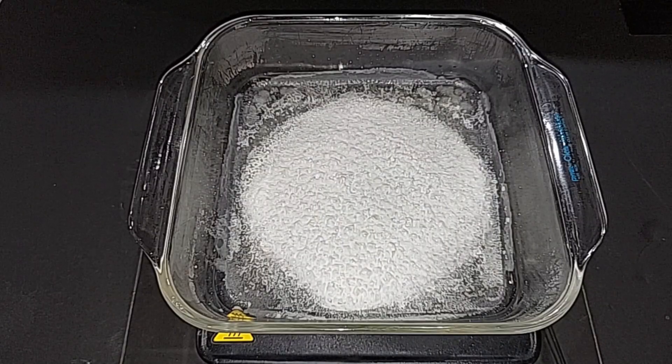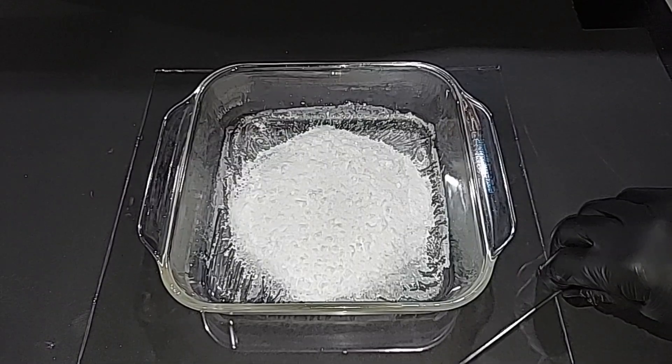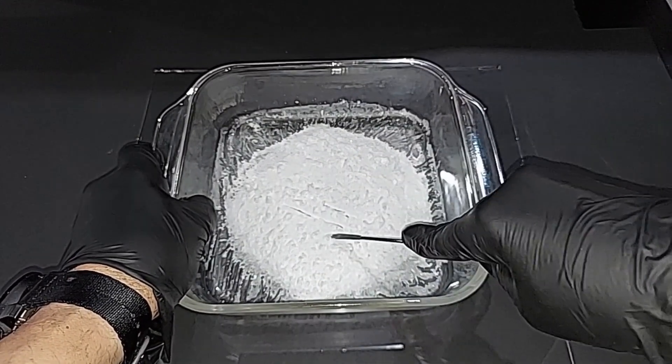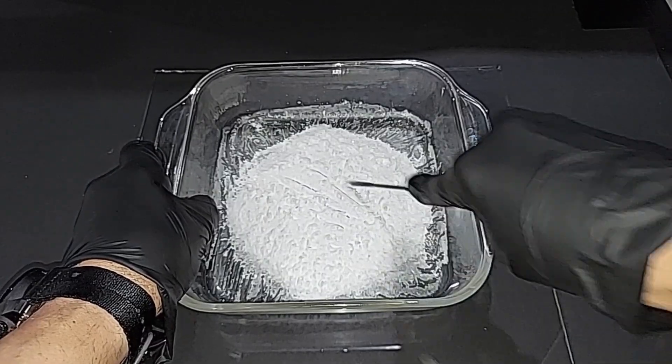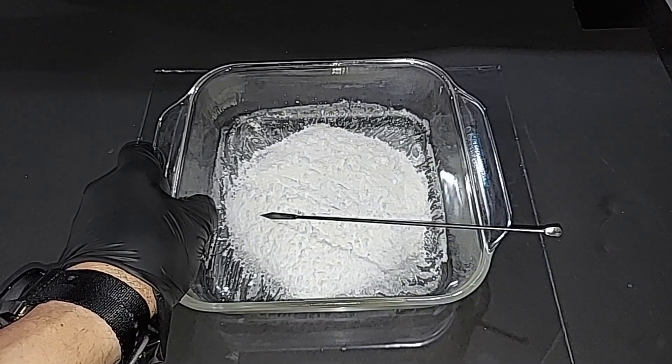Once it cools, I'll scrape it out, we'll weigh it, and then we'll test it for nitrites. I really don't know how hard this will be to get out. Some of these are just so difficult, but this isn't actually that bad. Oh, not bad at all. Okay. I'll be working on this, and I'll be back.